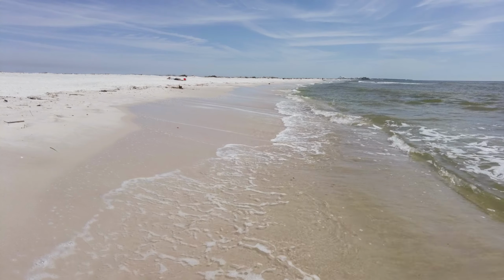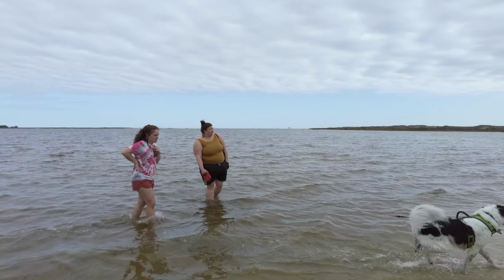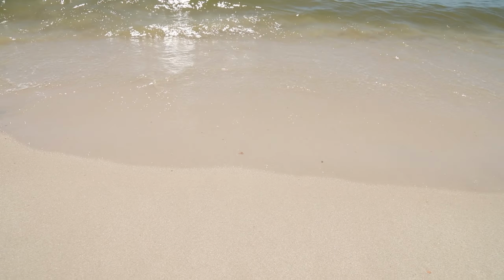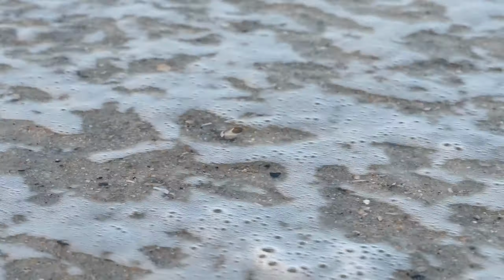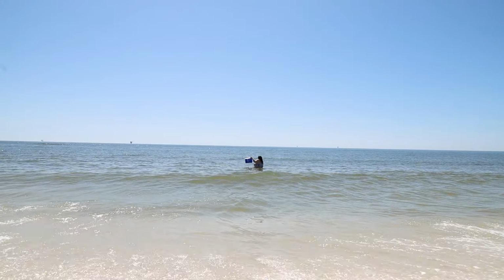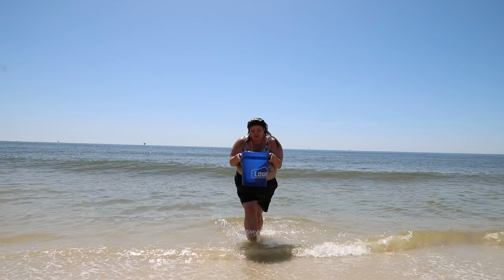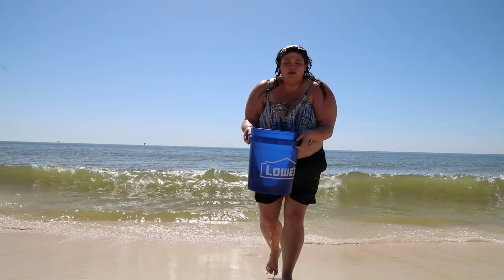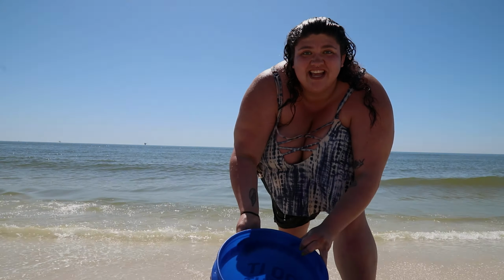The first thing we'll need to do is go collect some sand. This is a great excuse to go hang on the beach for a little while. We walk down the beach, soak up the sun, and go for a swim before collecting a bucket of sand. While meiofaunal organisms can be found in most marine sediments, the sand that you can collect at the beach can be anywhere from where the waves break to as far out as you want to go. When collecting your sand, it's important to gather just the top couple of inches of sediment, because this is where most of the organisms are. Then you have to carry your sand home and you can start the extraction.